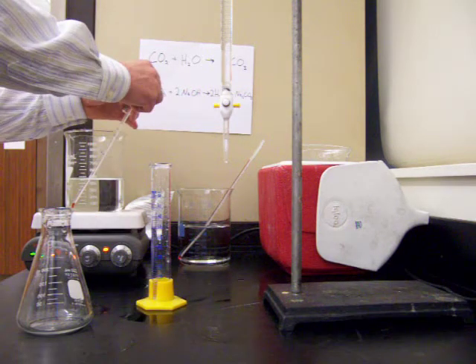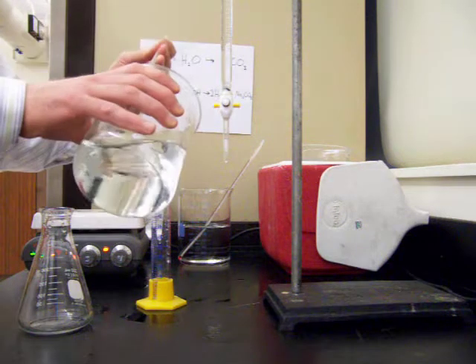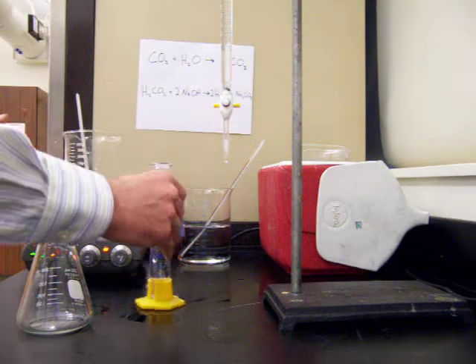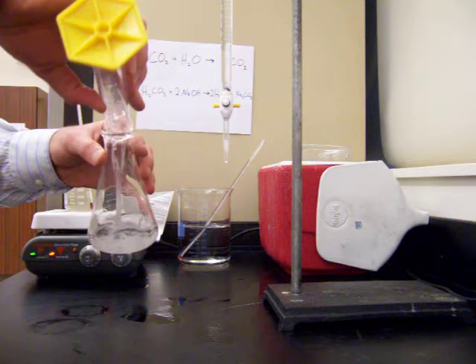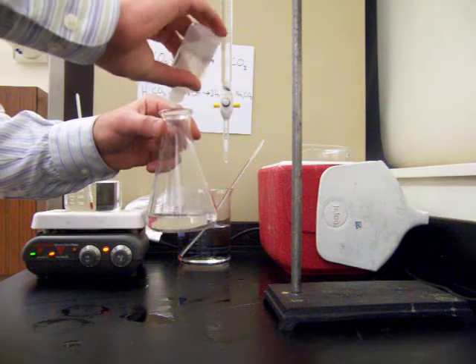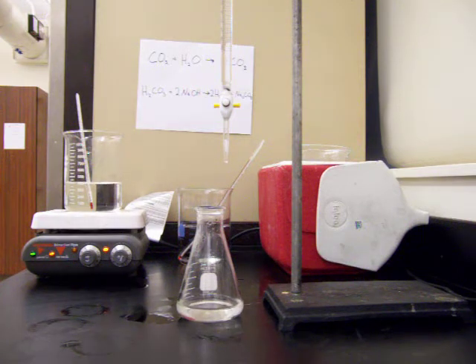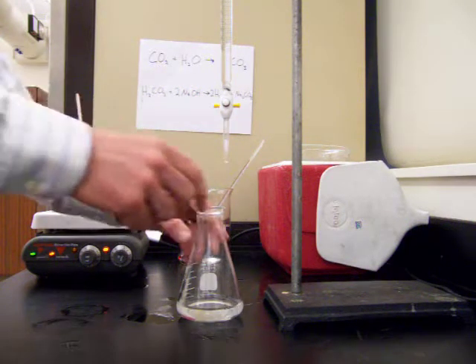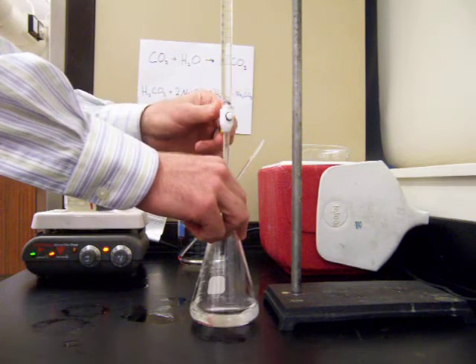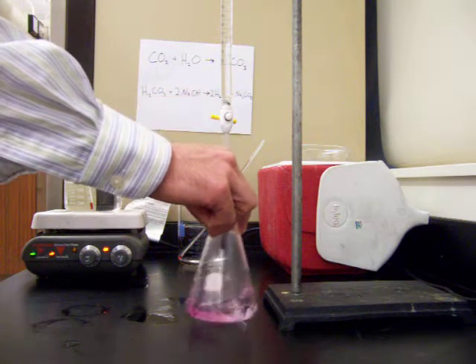We have one more titration to do — that's for the warm solution, which is 36 degrees Celsius right now. We measure out a 50 milliliter sample, pour it into the Erlenmeyer flask, and add a little bit of indicator. The initial volume in our burette is 28.3 milliliters, and now we're ready to begin the titration, adding sodium hydroxide.